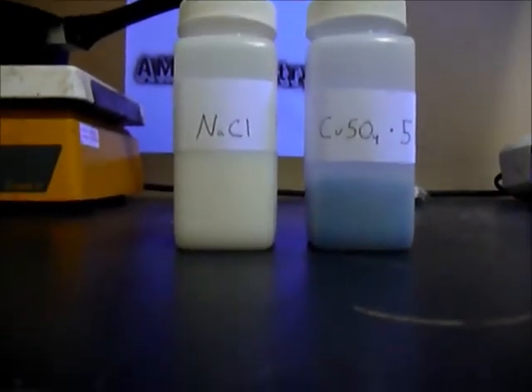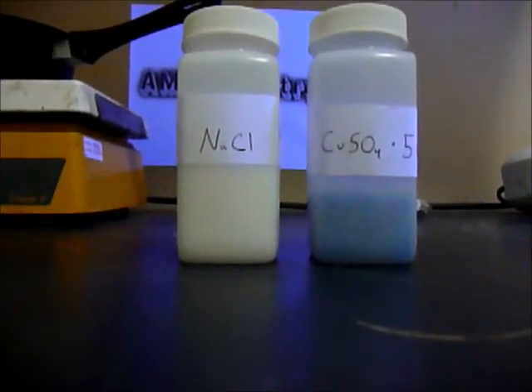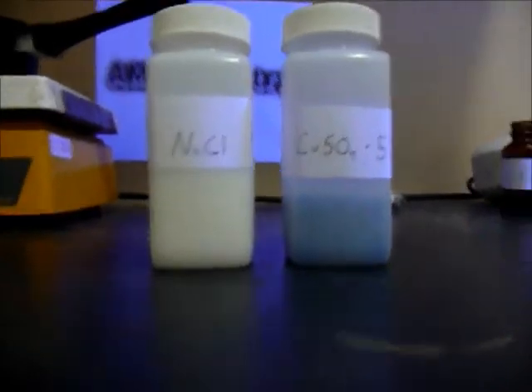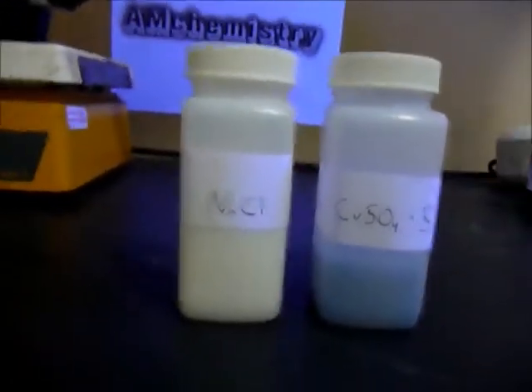Hi guys, today I'll be showing you how to make copper chloride and the chemicals you need is copper sulfate and sodium chloride.